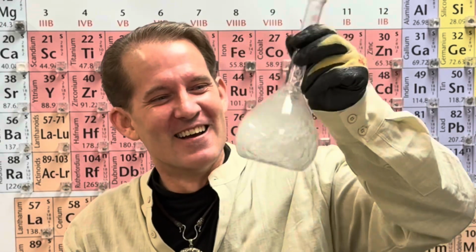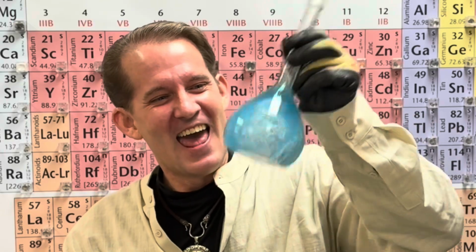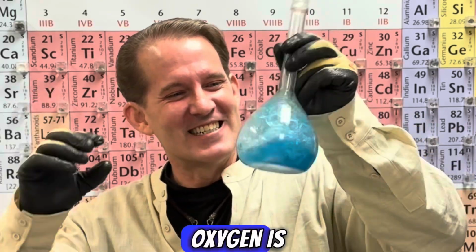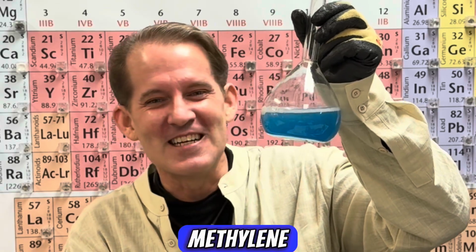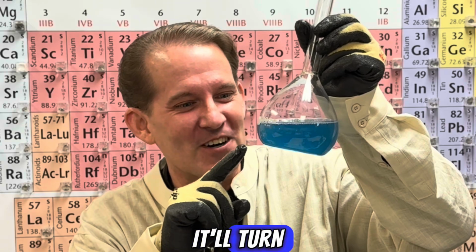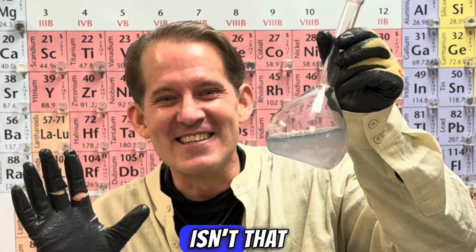Here we go again. I'm gonna shake it. Right now, oxygen is dissolving in the solution. It oxidizes the methylene blue and it's blue. Now just watch for a moment and it'll turn clear. Look at that. Isn't that cool?